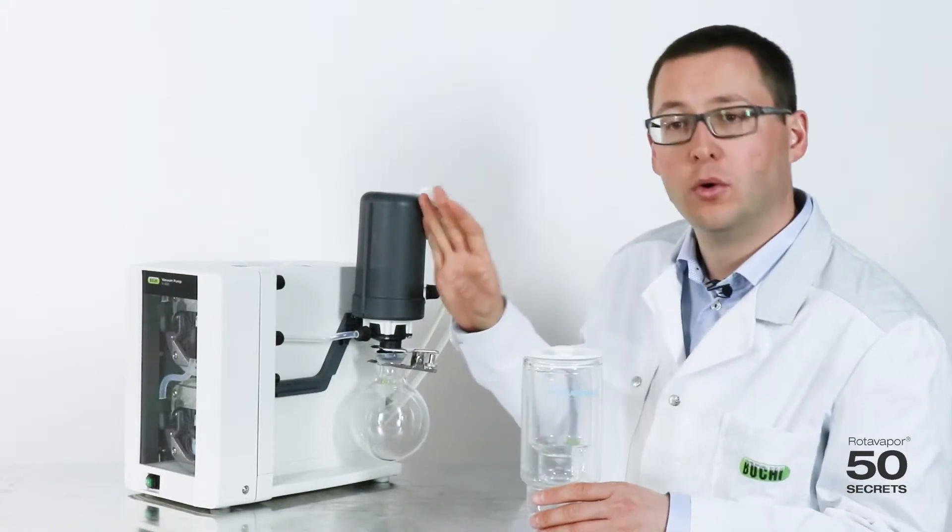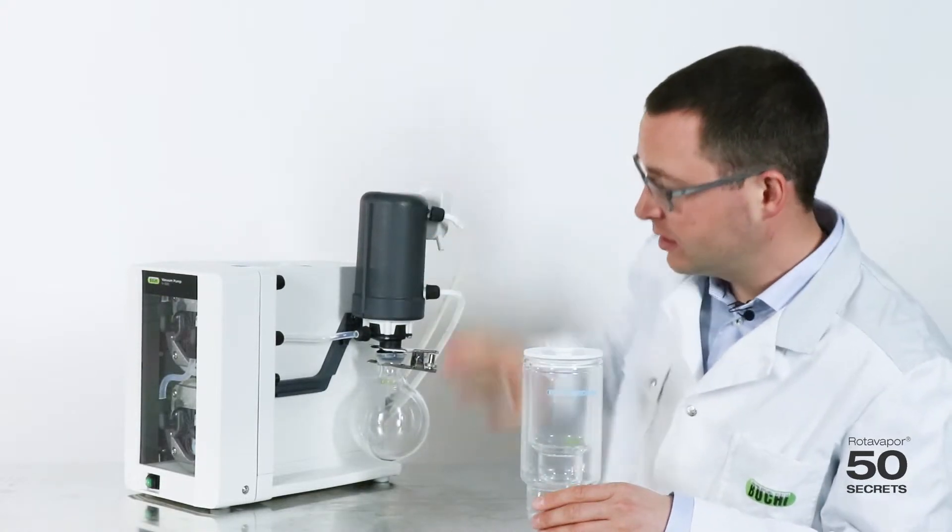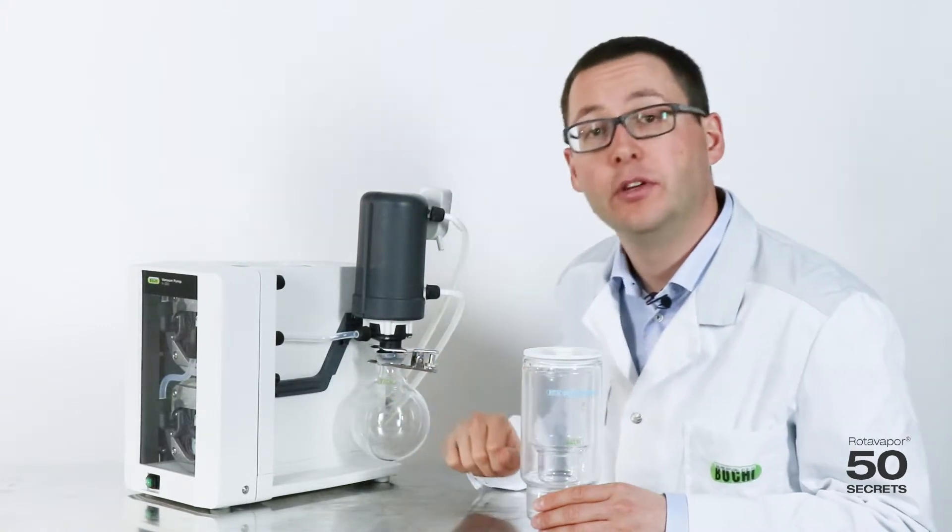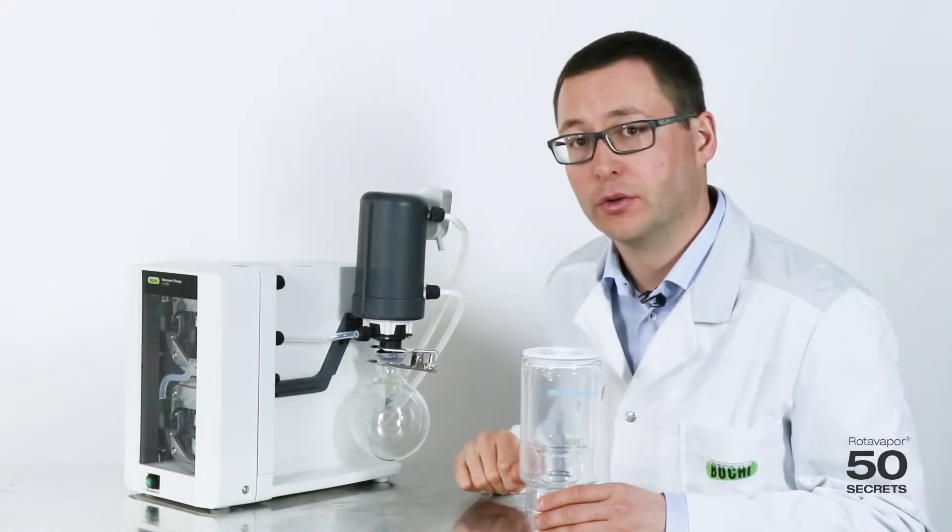We want to keep all the solvent vapor condensed and then in the receiving flask. That's the main reason for the secondary condensers.